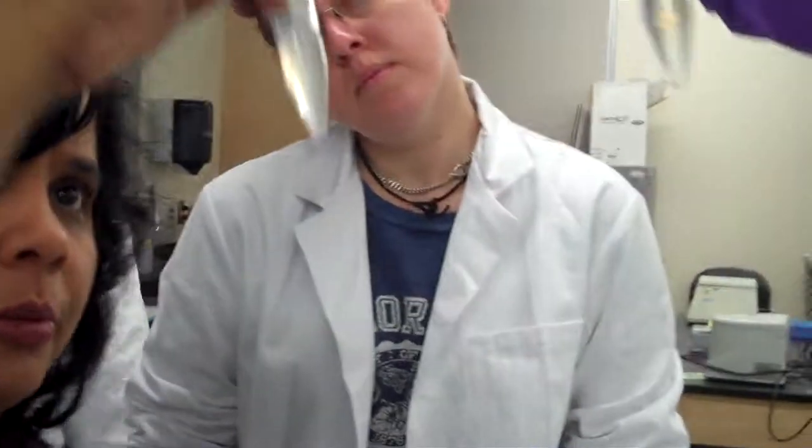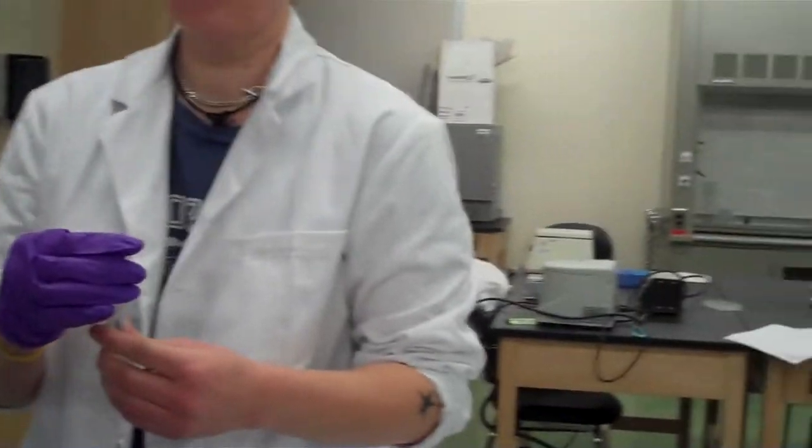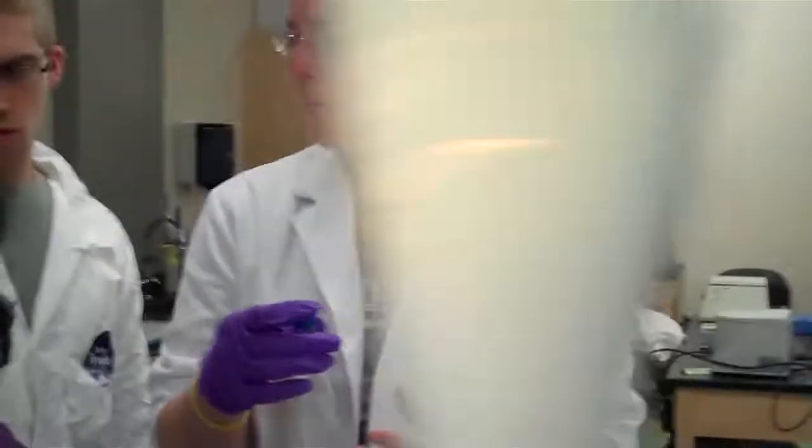What's this one? That one is almost there. These are about the same. This one's a little bit more turbid. If you put it on the shaker, maybe an hour, it'll fill up. Should I put this one on the shaker? Let's see. No, that looks pretty good. Alright, so these go on the shaker. An hour on the shaker will take care of it. So let me take that. Okay, maybe I should stop it.